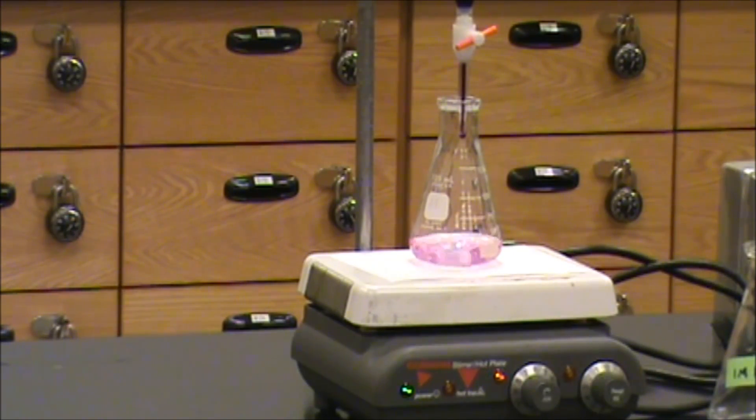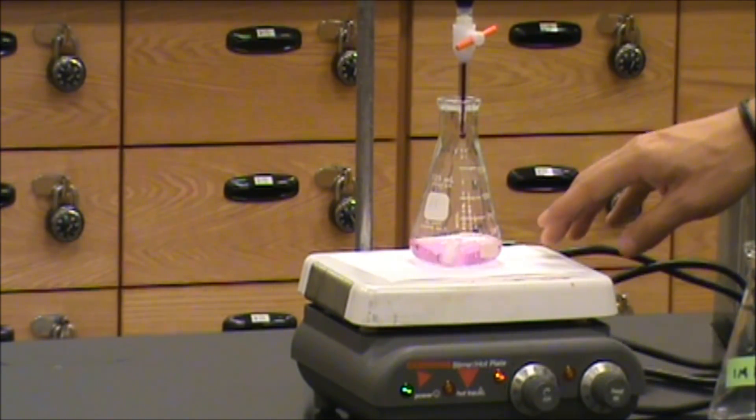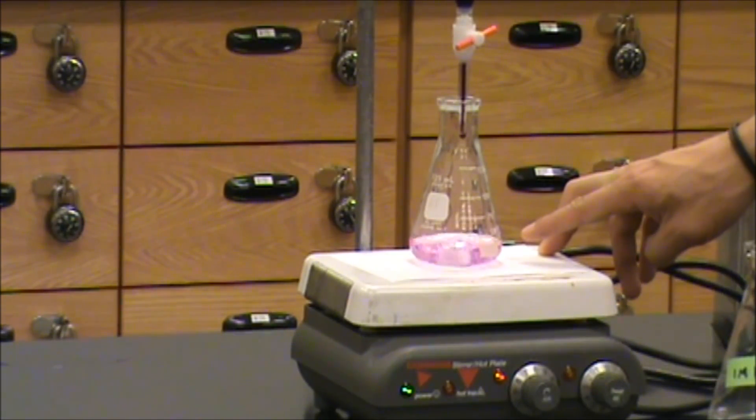A deep purple color would mean we've gone too far. And so there's our endpoint right there. It looks like it's going to stick around. This color should persist for at least 60 seconds.